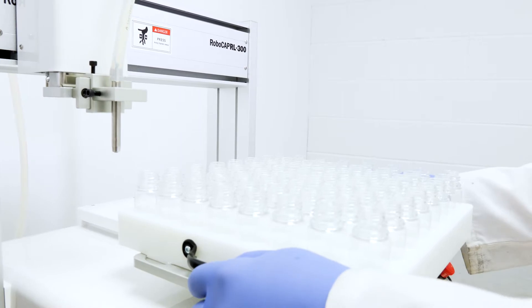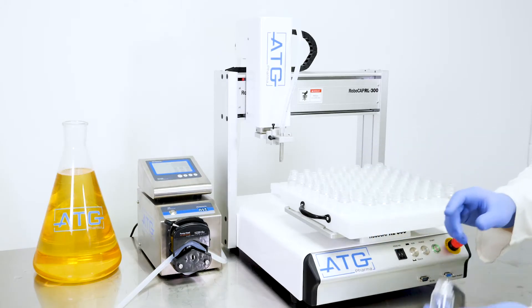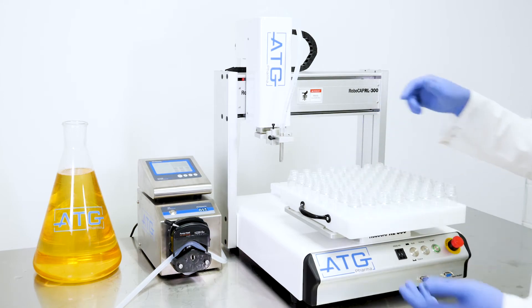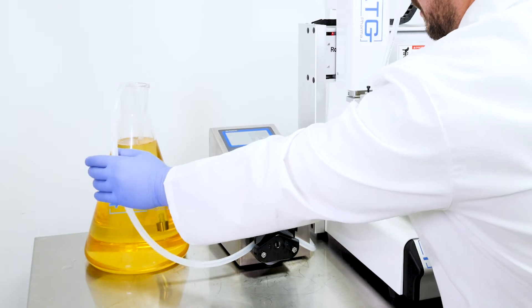First we'll put our tray onto the base plate of the robot. We custom mold these trays to fit the spec of whatever shape size bottle that you desire to fill. You can insert the product tubing into any container that your product is originally in.